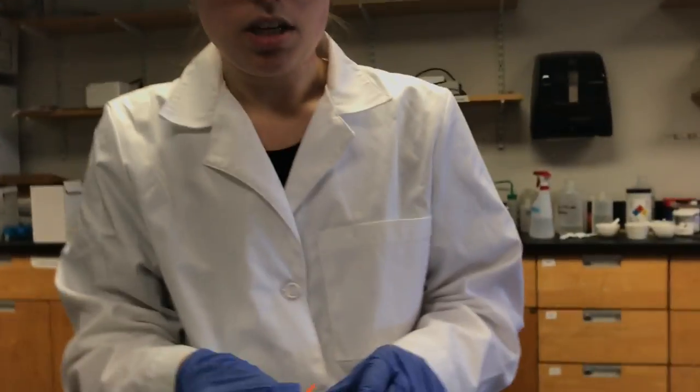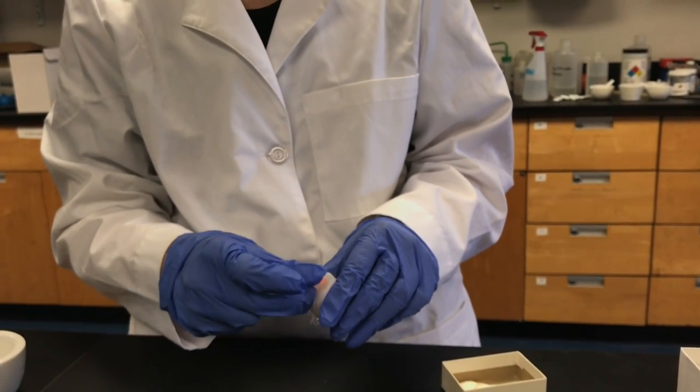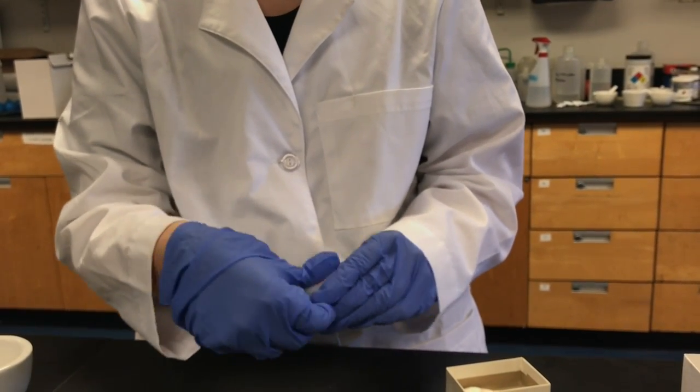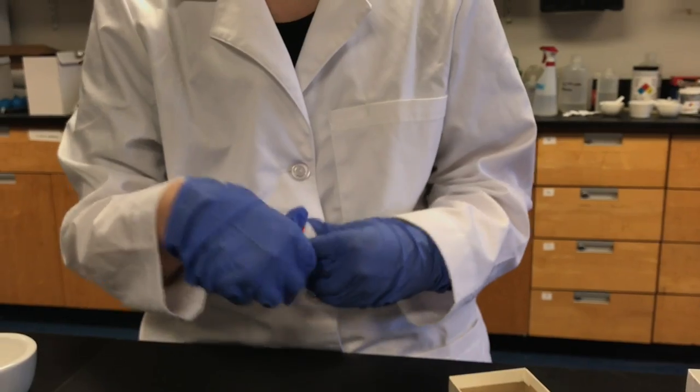Another thing that you're going to want to do before you transfer this over to the XRF machine is put this little sticker on it and then write what sample number you are doing on it. Okay, and that's this week's lab. See you again next week.